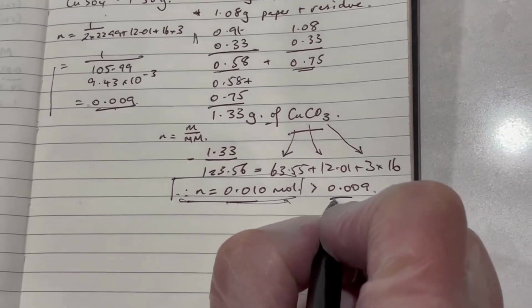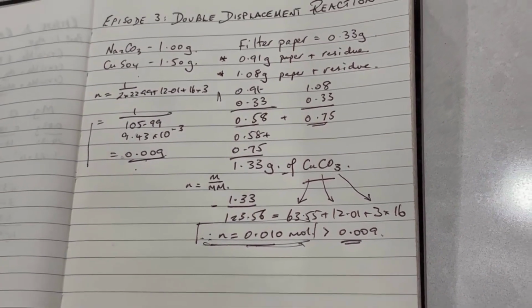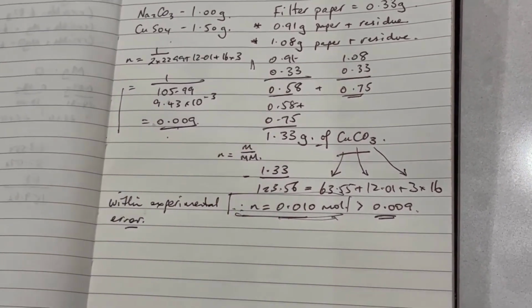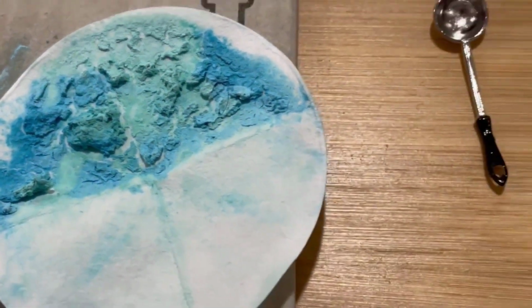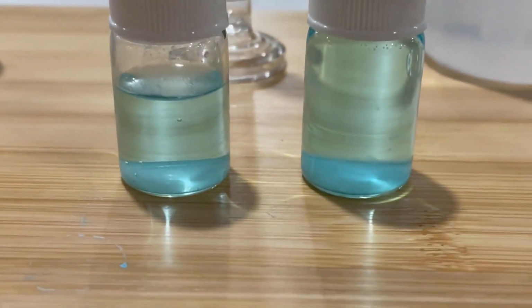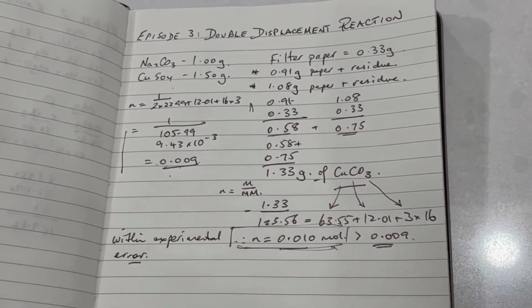Now this is slightly more than the calculation which I've reproduced here for you, just slightly more. Some of it is what we might call within experimental error. However, the fact that it is a little higher suggests that maybe there is still a little bit of moisture that is left in our residues, as you can see. And because we've also got a little bit of the copper ions in the filtrate, then clearly that filtrate has copper still in it. So that means that copper has not precipitated out of there. And indeed, there looks like a little bit of residue in the bottom. So we've got a few little sources of error.